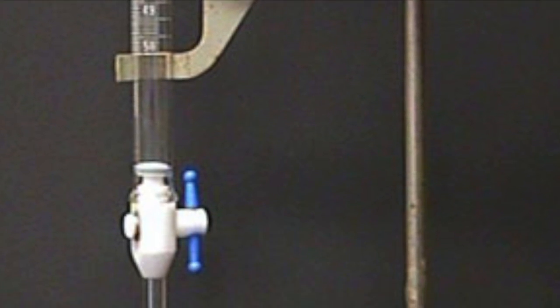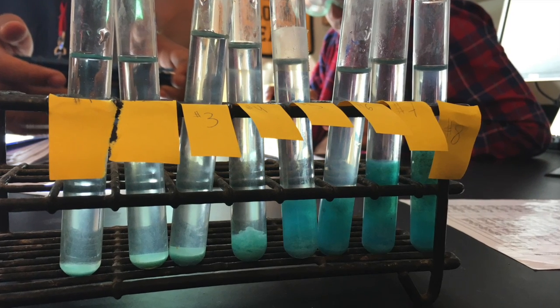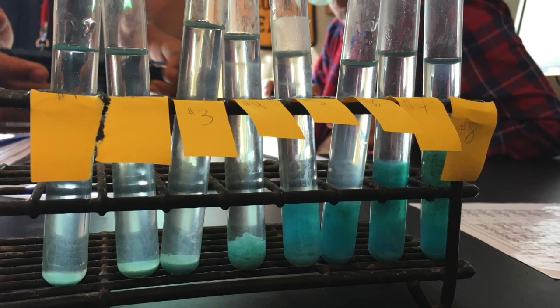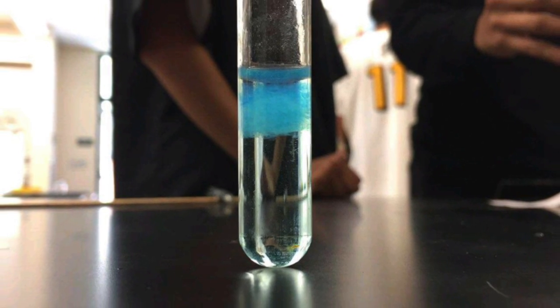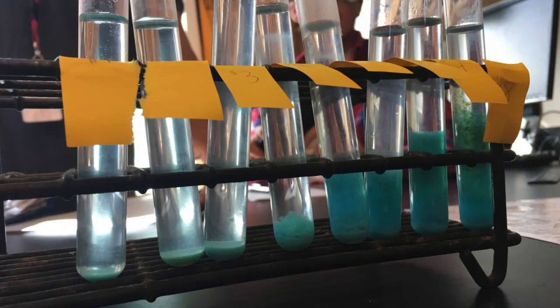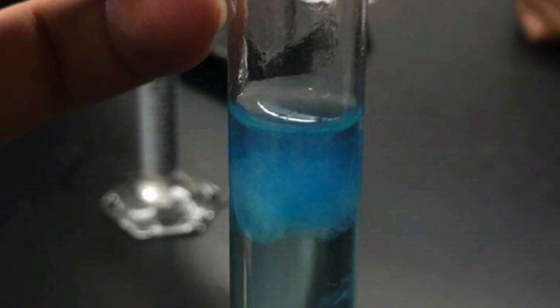Using the buret, we dispensed 5 milliliters of copper sulfate into all 8 test tubes and added an increasing volume of potassium hydroxide, starting at 1 milliliter and ending at 8 milliliters, eventually putting water into each test tube to have a maximum height of 13 milliliters. Finally, we mixed all 8 test tubes with a spatula to get all elements evenly distributed and waited 15 minutes for the precipitation to take place. After the 15 minutes, we saw that the precipitation occurred and we measured it in millimeters using a ruler.